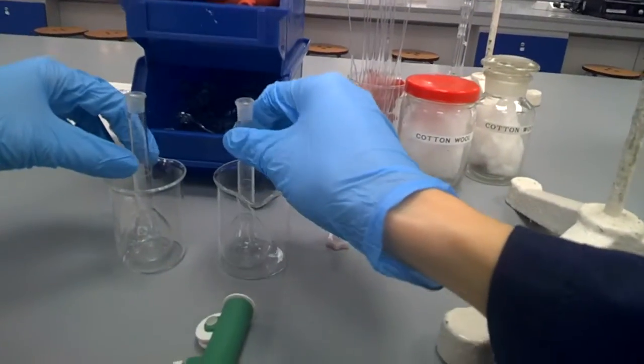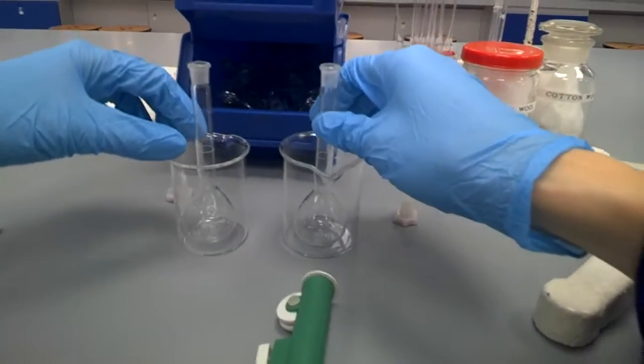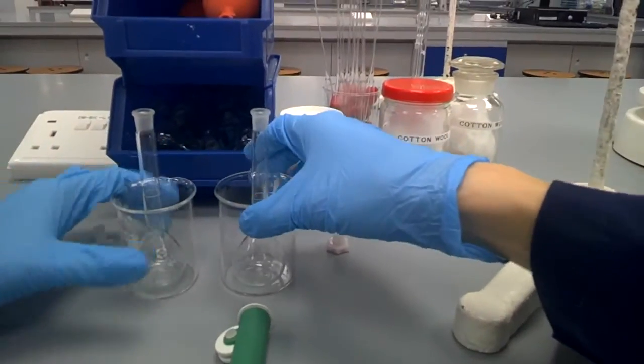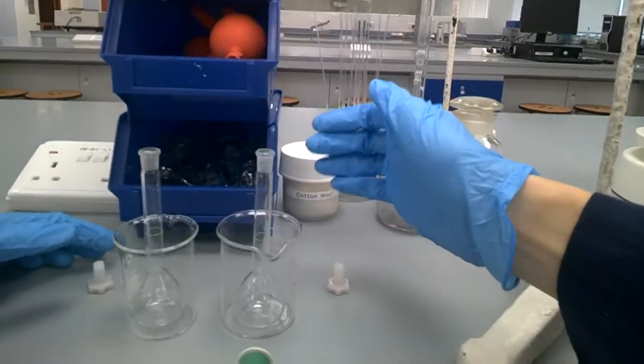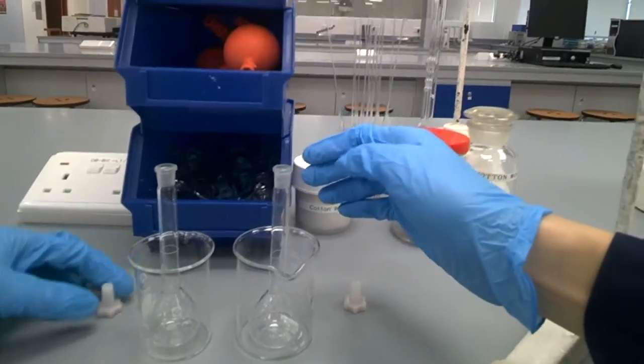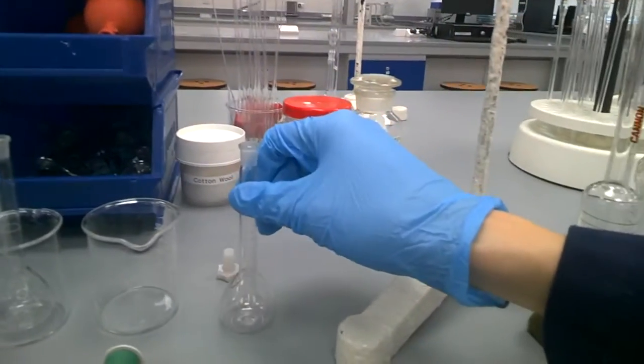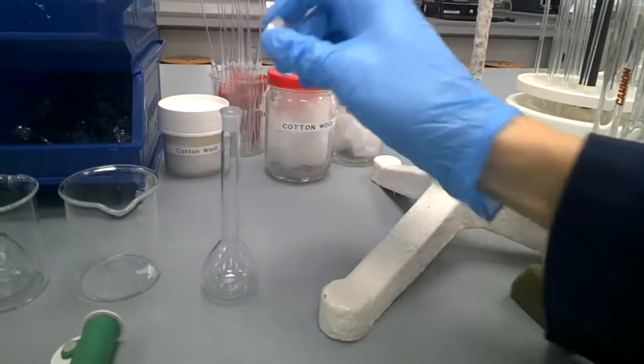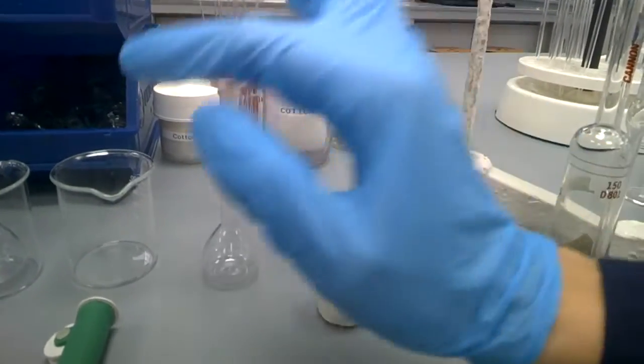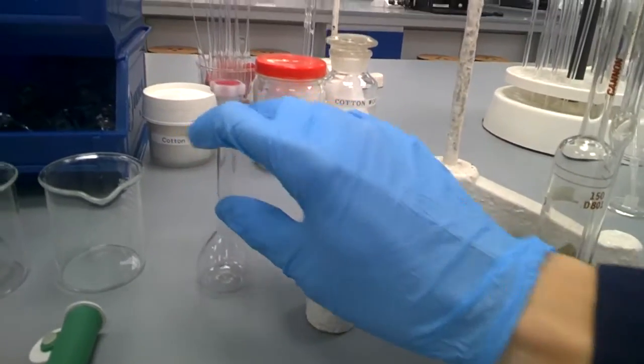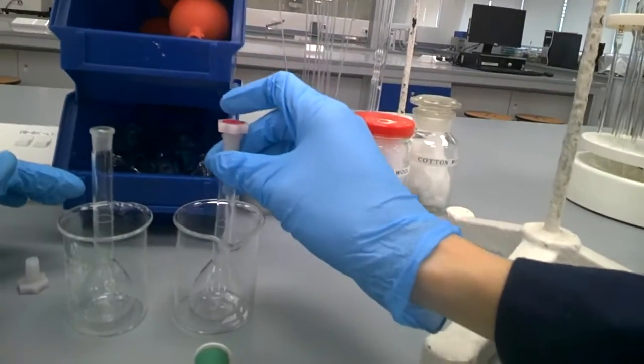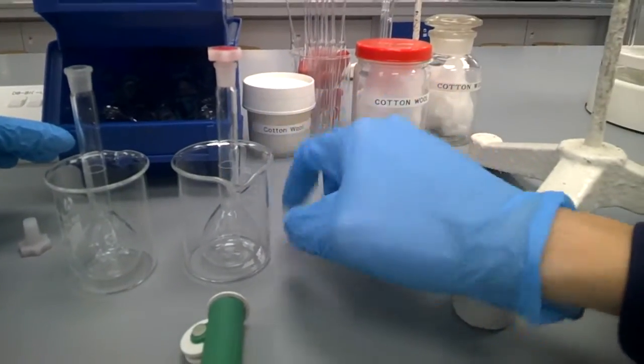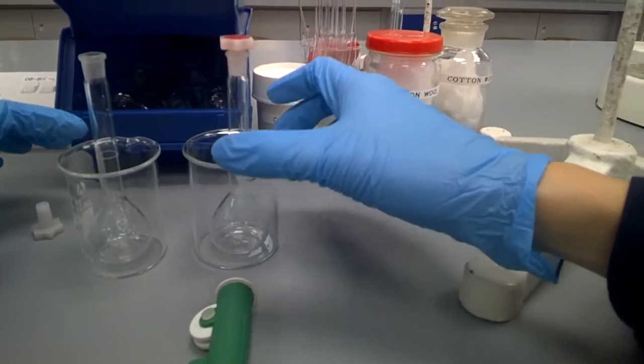And here you see 25 ml volumetric flask to make up the solution of a polymer. You might ask why do we need to put it inside the beaker. It's for our safety reason too. Now in case you put it outside with the cap on, a careless knock might break it and topple and all your hard work will be gone. But if you place it inside, in case there's some hairline crack, the toluene and polymer could still leak out and you have a secondary catchment.